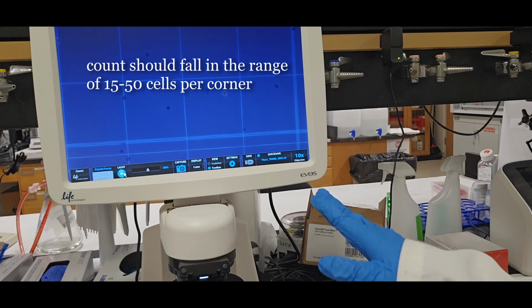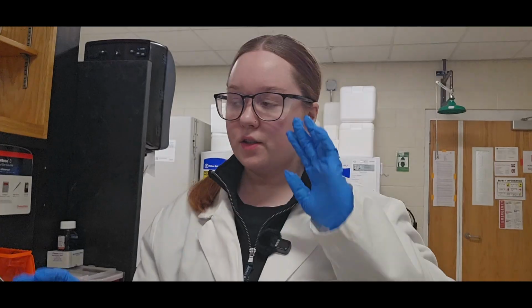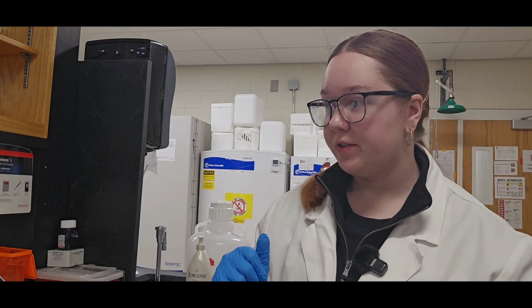which technically, to be an accurate cell count, you would want to see 15 to 50 cells per corner of the hemocytometer. So if this was cells that I just passaged, there would not be enough cells for me to get an accurate count, which would not be good for the experiment, and I would continue growing them out until I knew that I could get an accurate cell count.